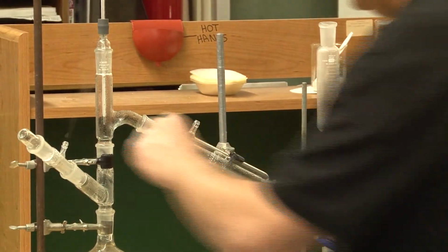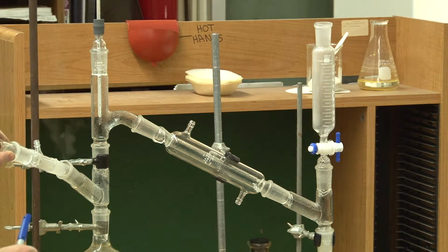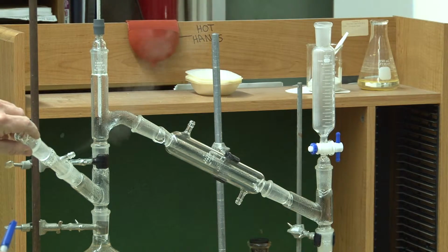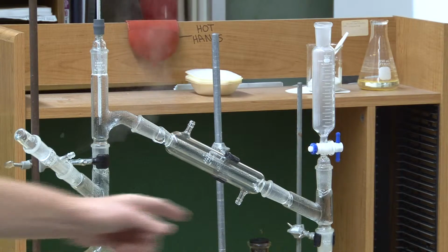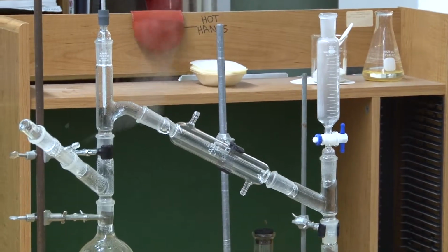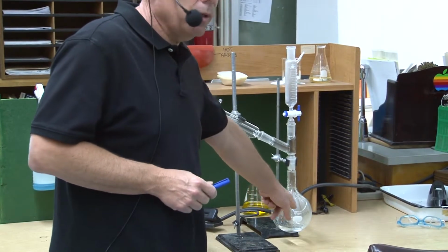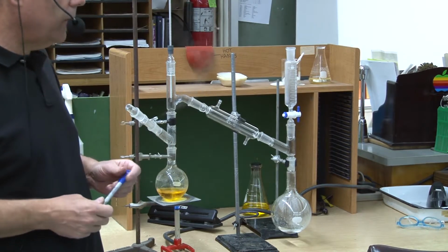Okay, I mean if I wanted to, I could pull this off and I could vent it out the end here. Okay, as you can see it's coming right out. But I might as well vent it in that direction. So anyway, I should have put a vent here, and the vent is specially made so the liquid goes into the vent and then circulates and then drops back down again, just like it's doing there. But interestingly enough, if this was contaminated with potassium dichromate at all, you'd be seeing some yellow in there, and you don't. It's perfectly clear. You could probably end up drinking that liquid right there.